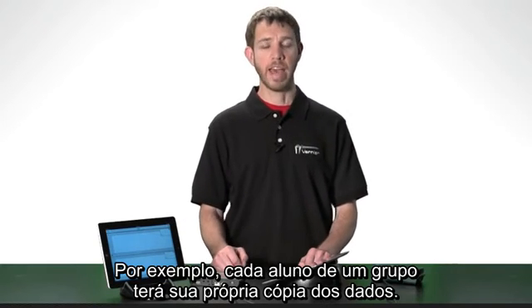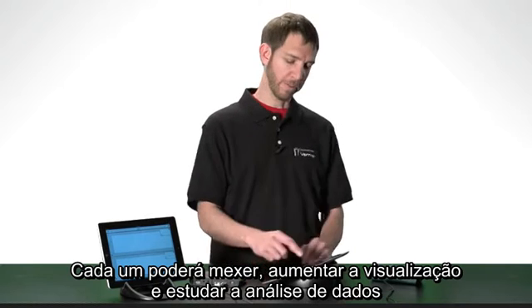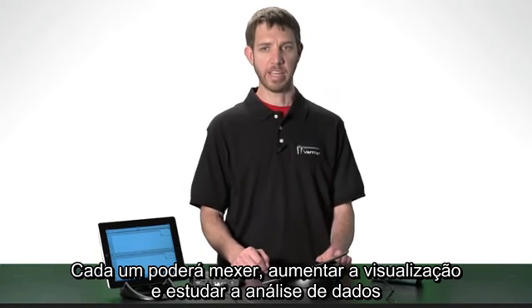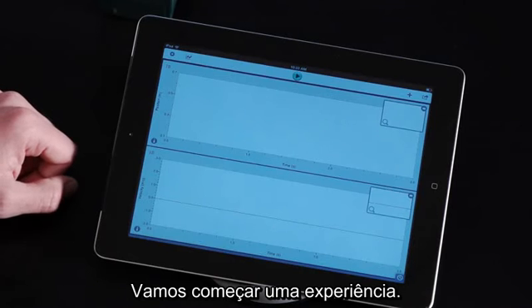For example, every student in the lab group will get their own copy of the data. Individuals will be able to pinch and zoom and annotate their data analysis, and all that will be auto-saved for each student. Let's begin an experiment.